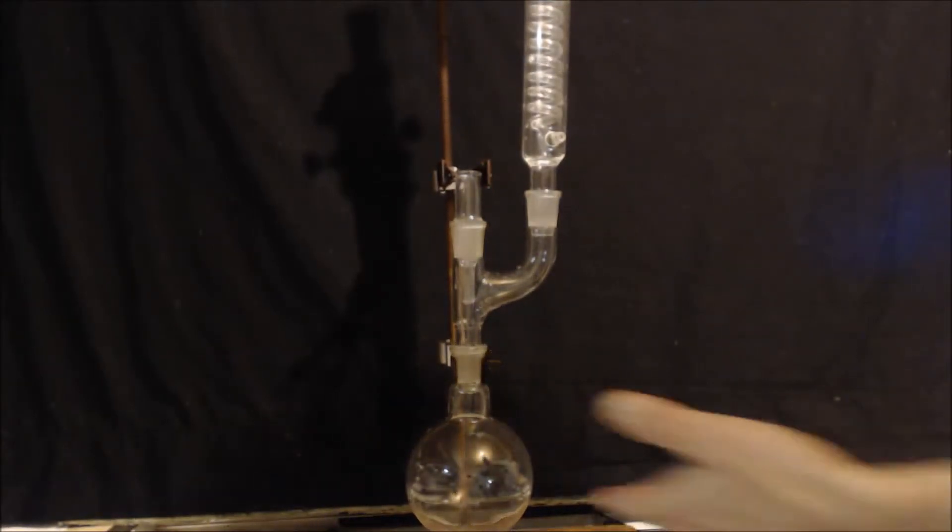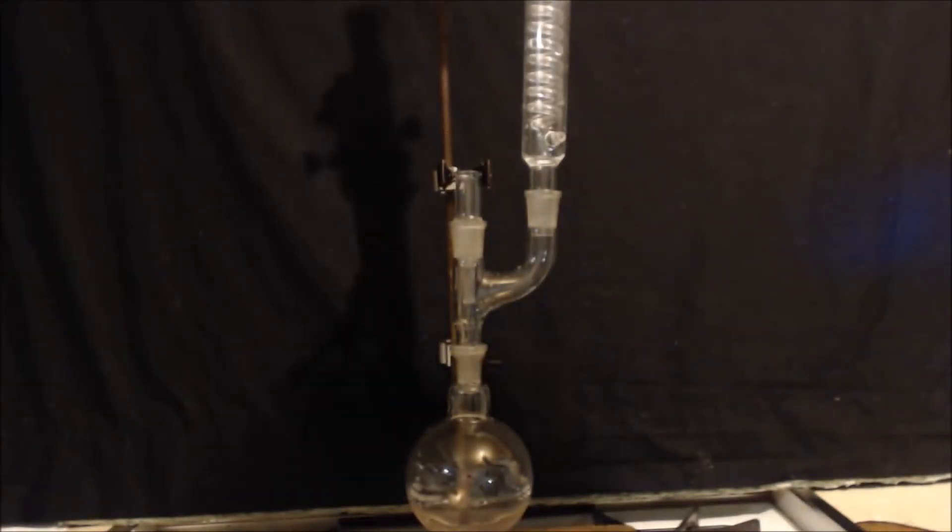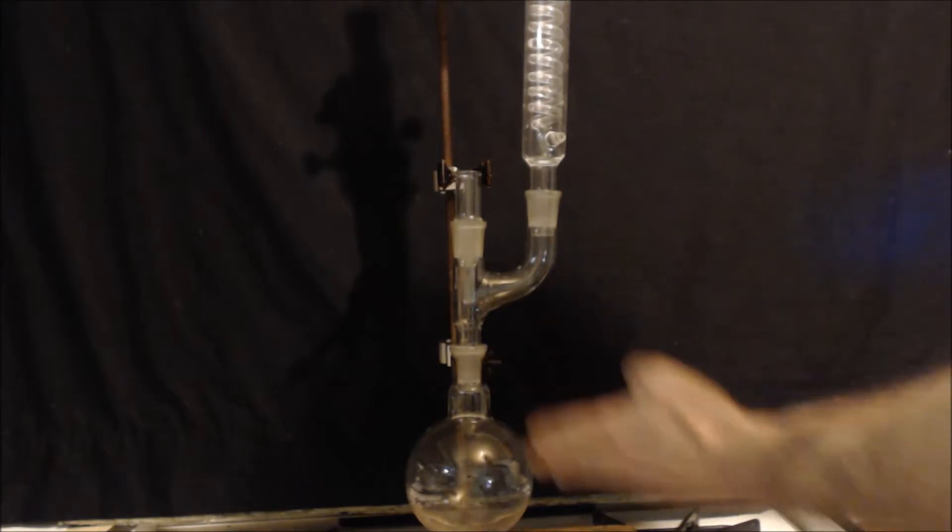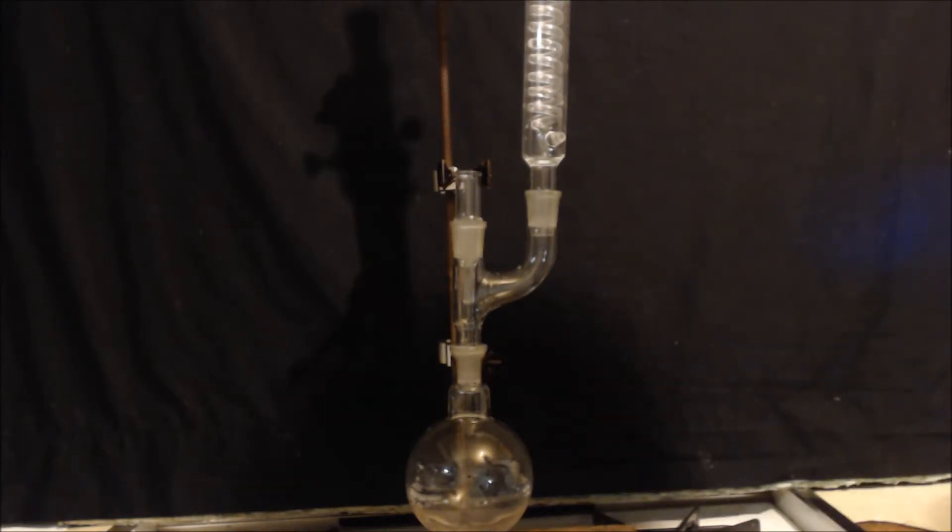So anyways, now you can boil this all day and reflux it. Because that's all refluxing is, is just boiling it, but boiling it where you make sure that you don't lose anything. All the vapors don't escape. They get refluxed back into the boiling flask. So you can boil this all day and not lose any of your vapors.